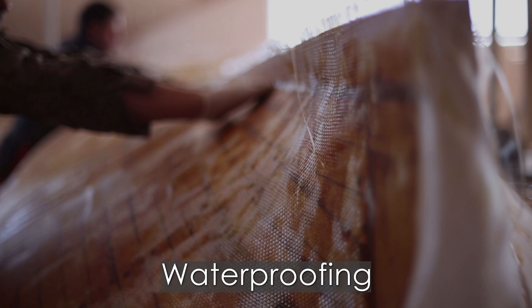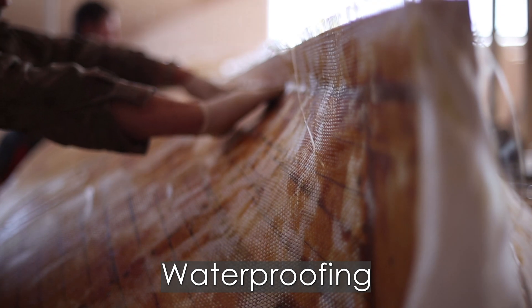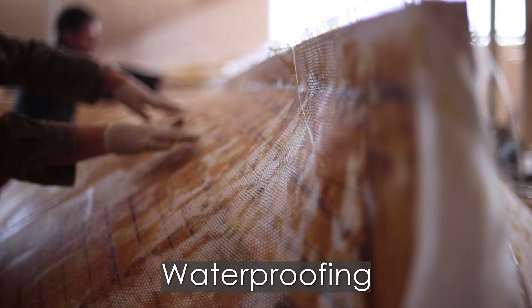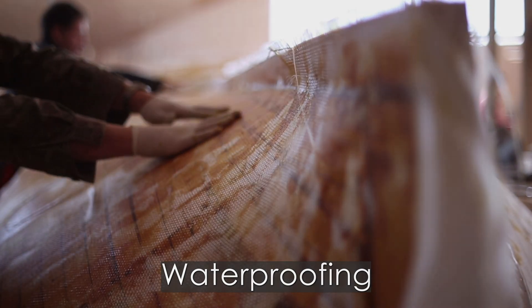This can be great for looking at a whole host of things like waterproofing of a waterproof coating or the adhesion of a coating to a solid.